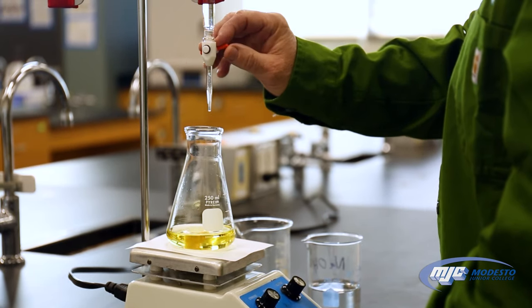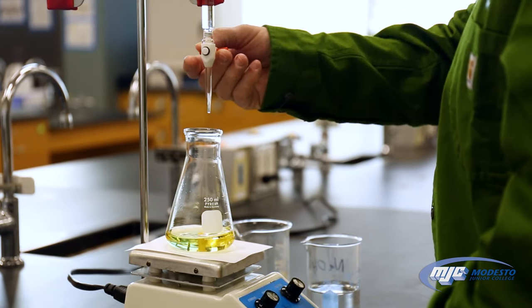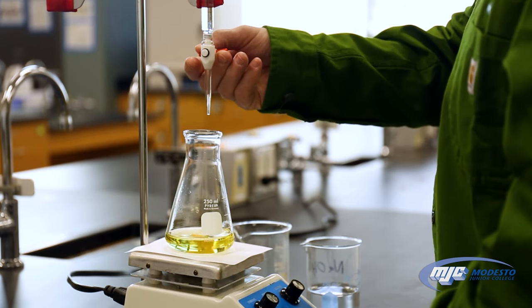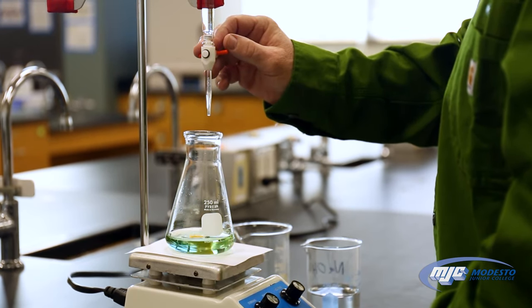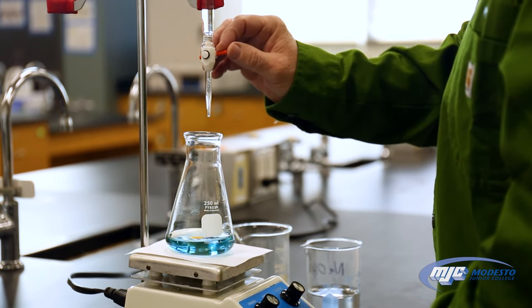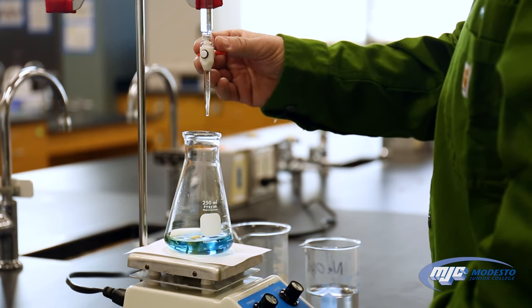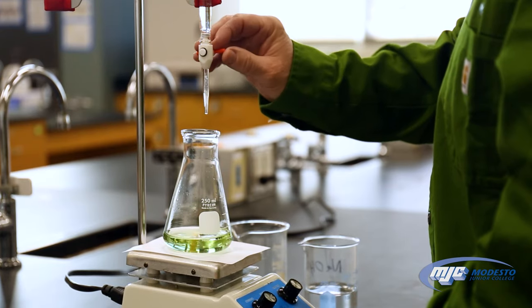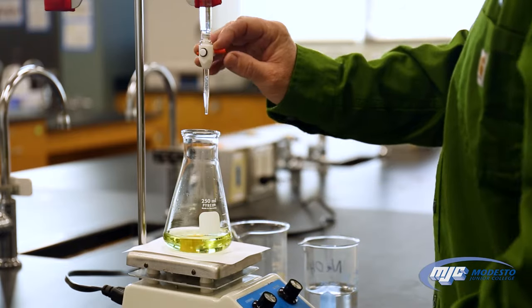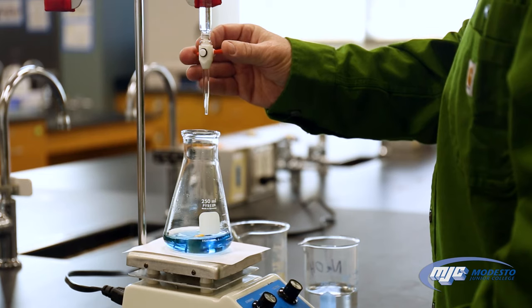It's hanging around — getting really close now. Watch that — almost. So I'm going to twist it really fast. Almost, one more maybe two. Can you see that green color? That means we're getting really, really close. We want that blue at pH 7.5. Really quick twist.